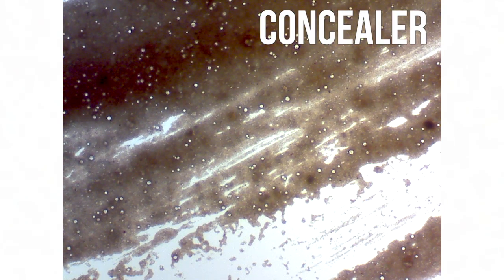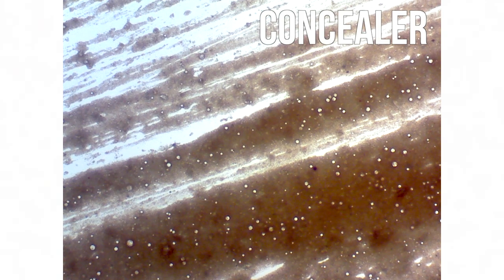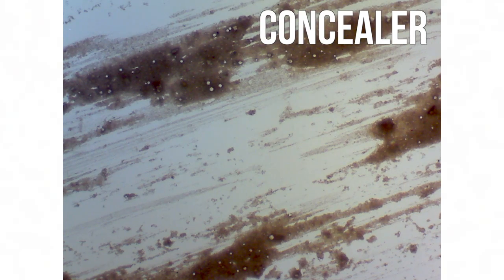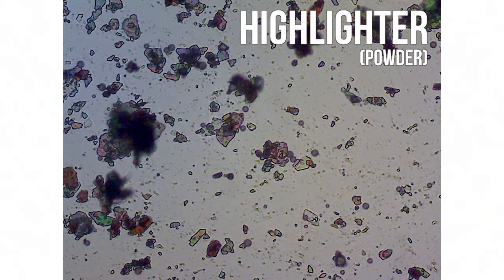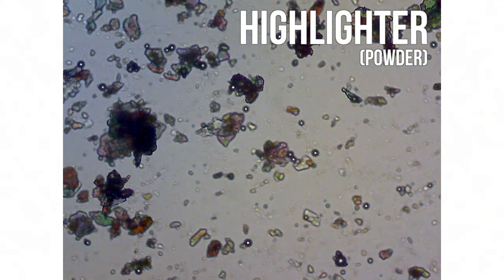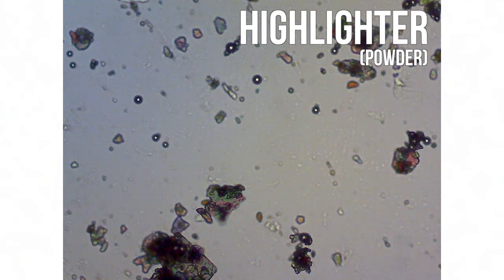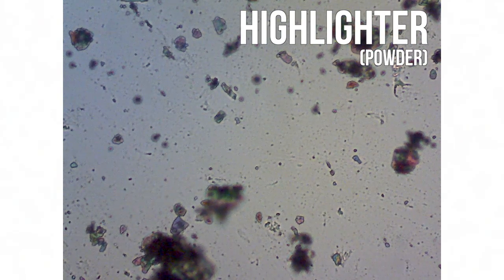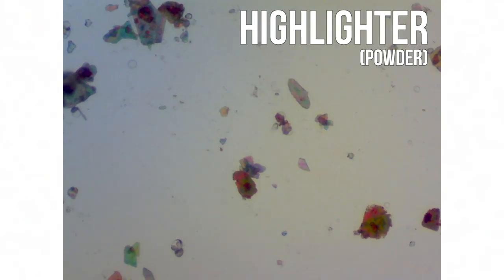Now it's time to check out the slides under the microscope. Here is my concealer under my microscope. On all these slides, I use my low and medium objectives. The highlighter turned out really cool, as you could see many different shades of different colors. Seeing as these objects were 3D, by changing the light levels on my microscope, I was able to see different parts of them.